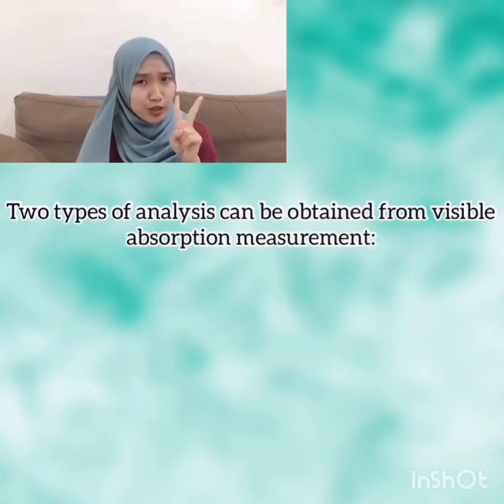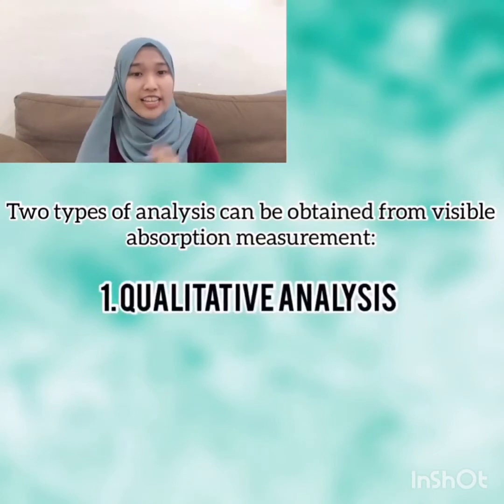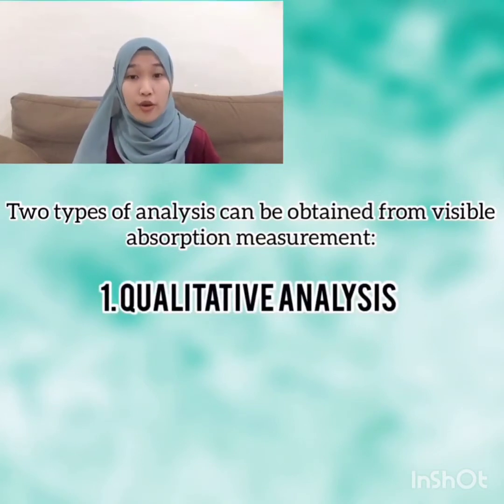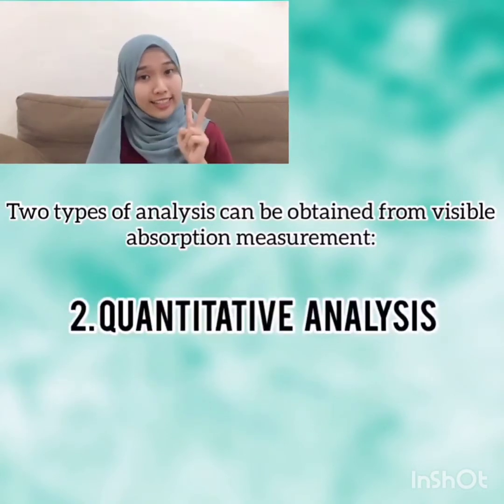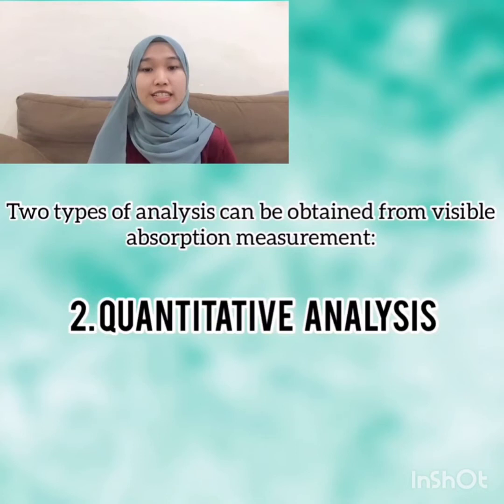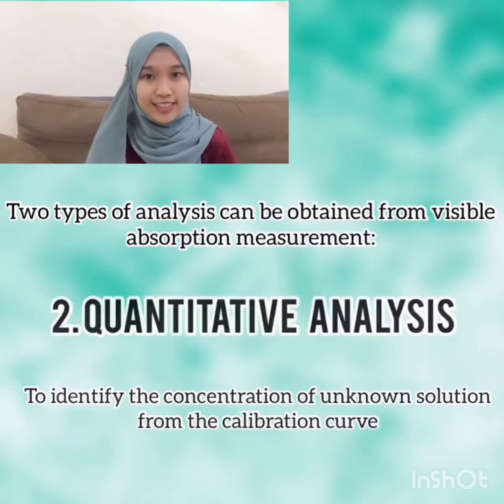Next, there are two types of analysis that can be done using visible absorption measurement. First is qualitative analysis, where the wavelength at maximum absorbance from the absorption spectrum can be determined. And second is quantitative analysis, where the concentration of an unknown solution can be identified from the calibration curve.